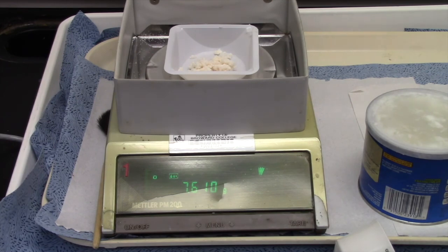Now, don't forget, this is wet, so I'm weighing the mass of a lot of water too. Alright guys, so there's the mass of our soap.